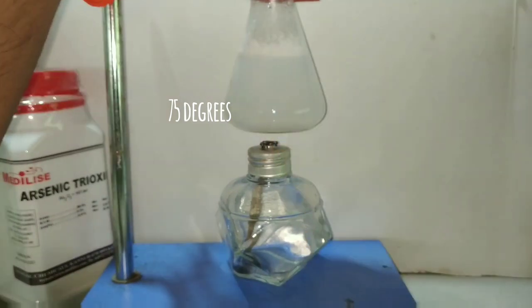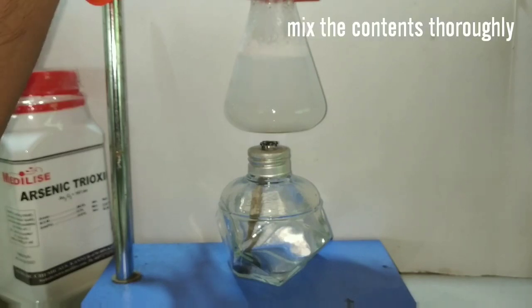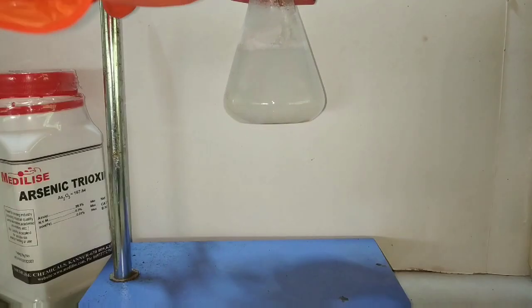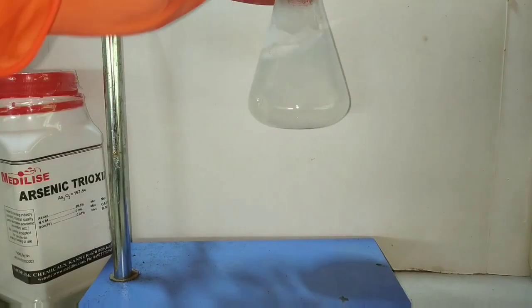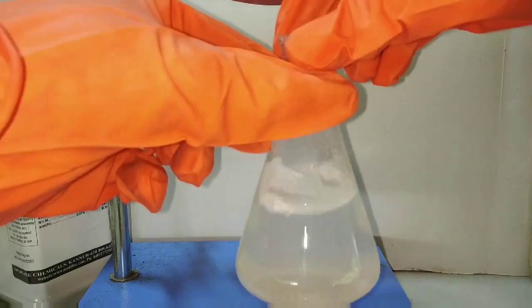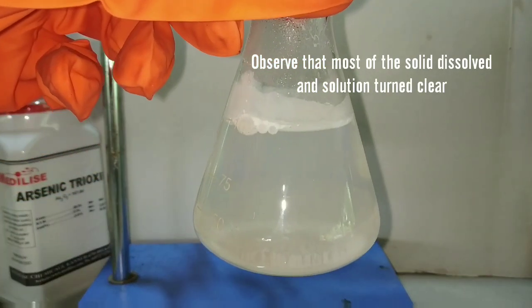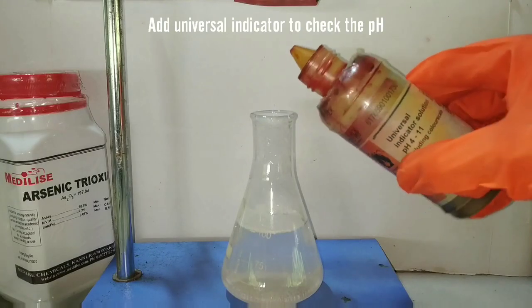Here you can see that the temperature of the solution has reached to about 75 degrees and now I will give a thorough mixing of the contents along with heating. Now we can see that after thorough mixing and heating, the contents has dissolved in the water.